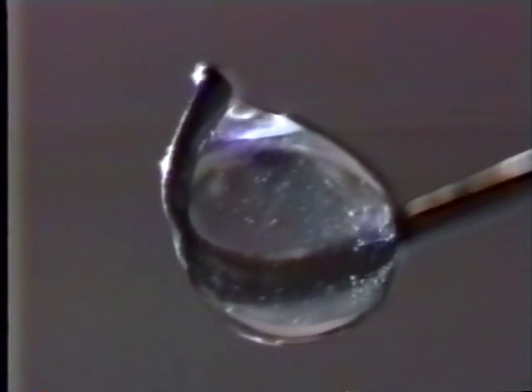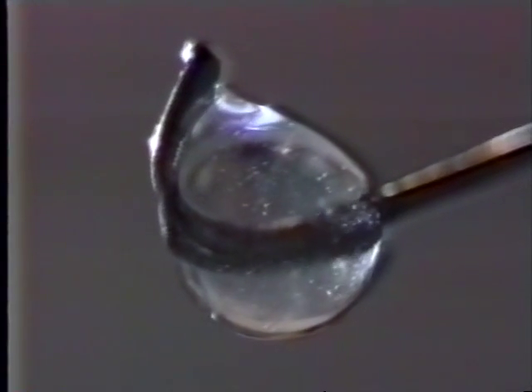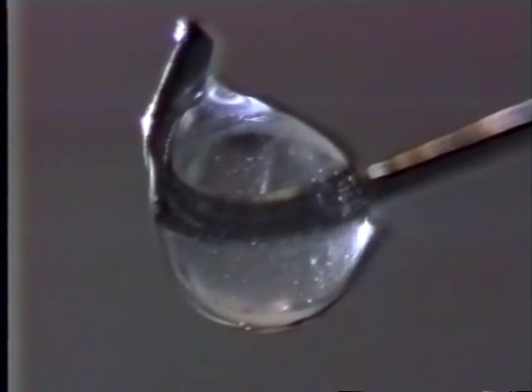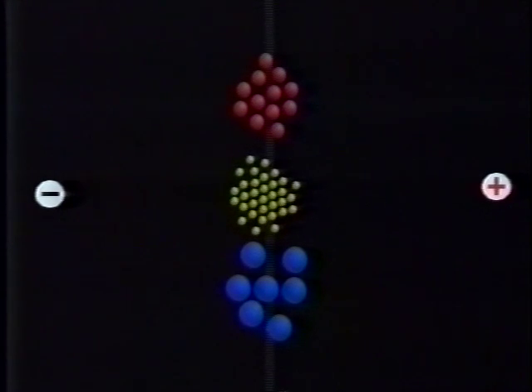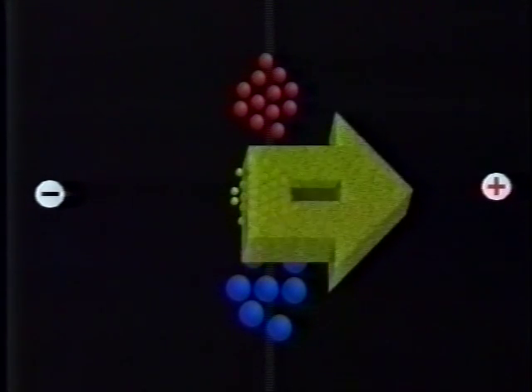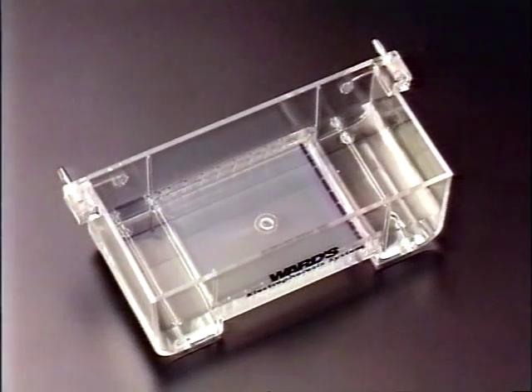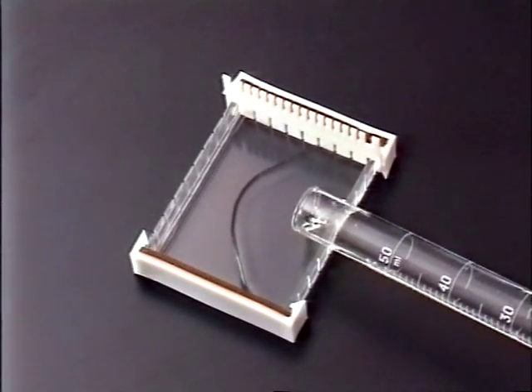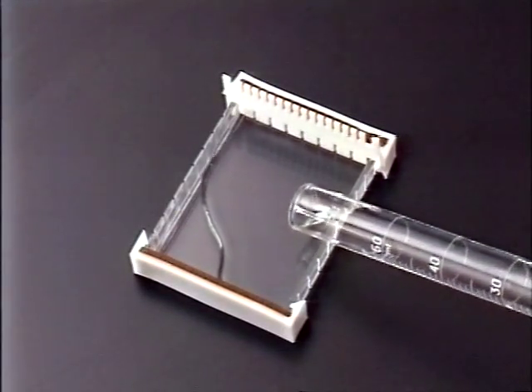After gaining experience with the system, it is time to run the real thing, DNA. DNA's phosphate backbone gives it an overwhelmingly negative charge. Therefore, the wells must be located at the negative electrode. Cast another gel with the wells located near one end of the gel.